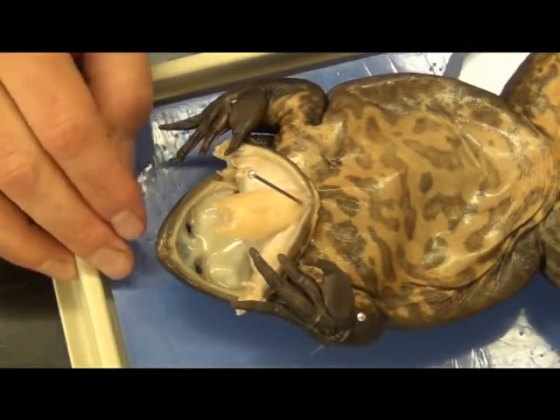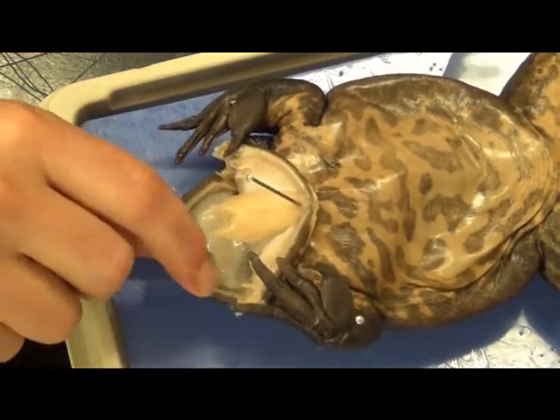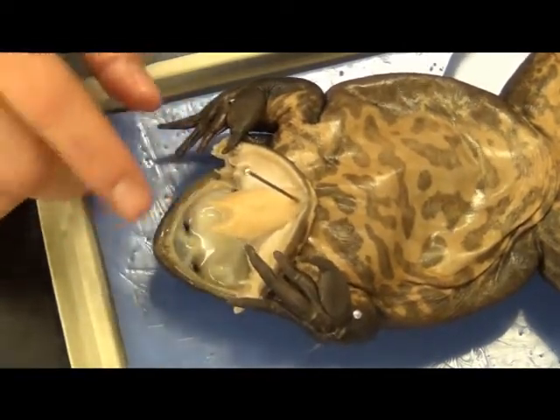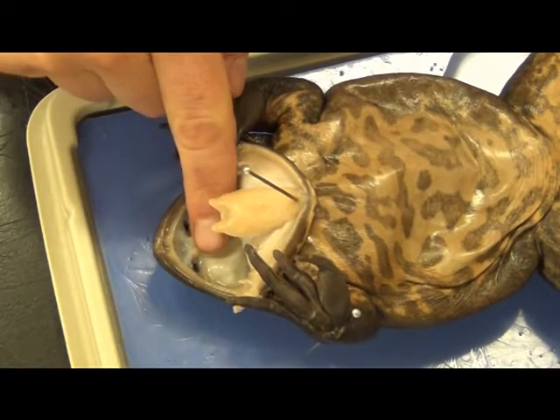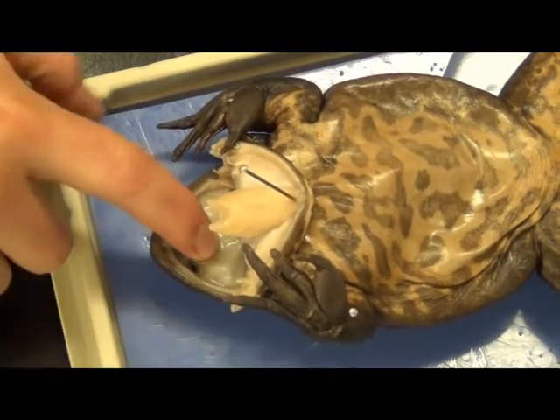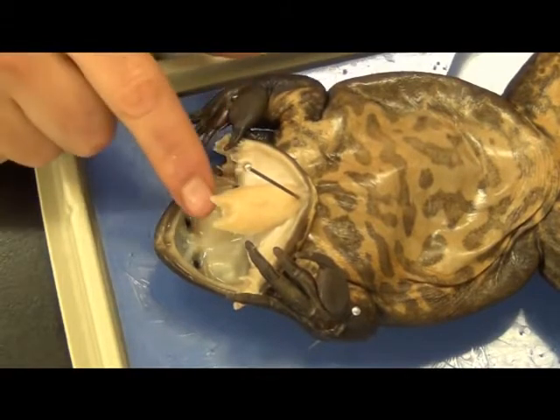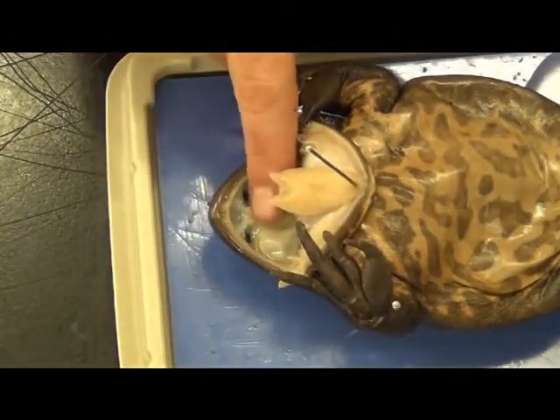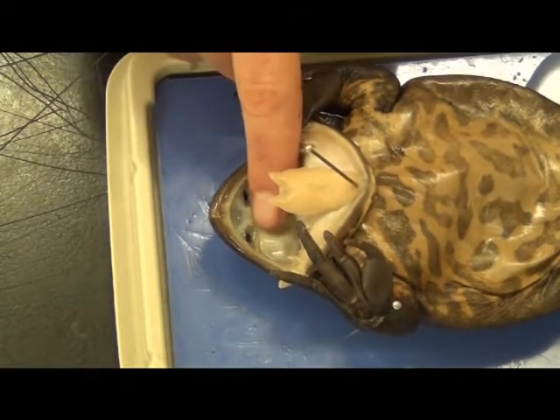You have two sets of teeth. Around the lip on the top — if you push down and inside, you're going to feel a very fine serrated edge. These are called maxillary teeth; they have the feeling of maybe a butter knife and are pretty good at grasping. The other set of teeth that most people are unaware of — my favorites — are called the vomerine teeth. If you look really closely, you'll find two little nubs on the inside of the internal nares. If you take your finger inside, push down, and try to pull back, you'll notice there are literally thousands of tiny microscopic barbs — kind of like Velcro — that are going to keep your finger from coming back out until you lift it off. They're built into the mouth, not exactly what we think of as teeth, but they definitely play the part.